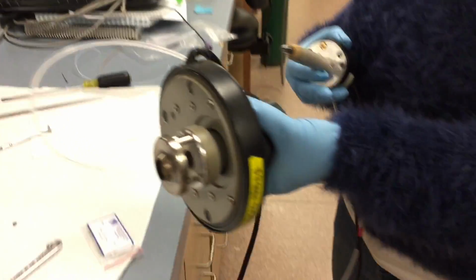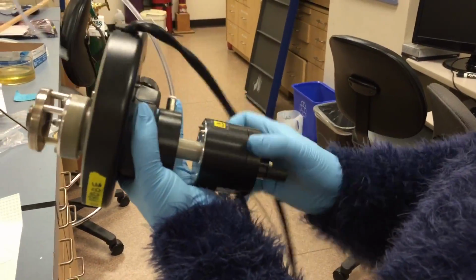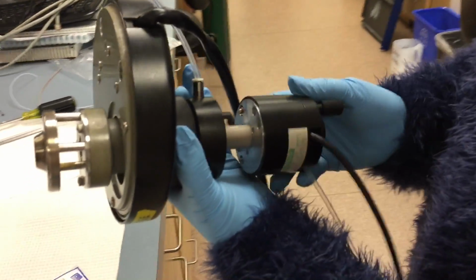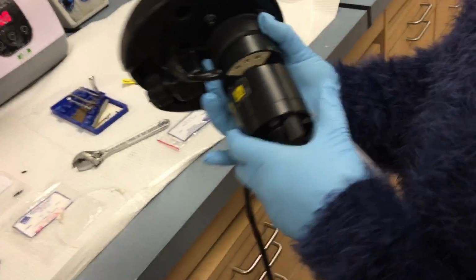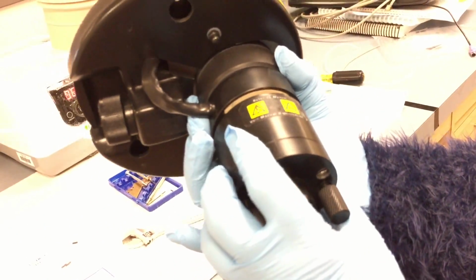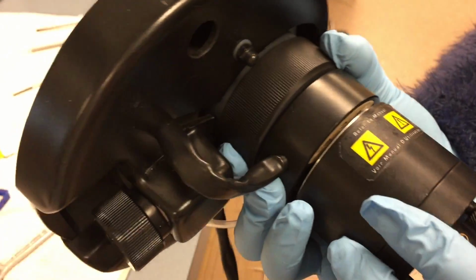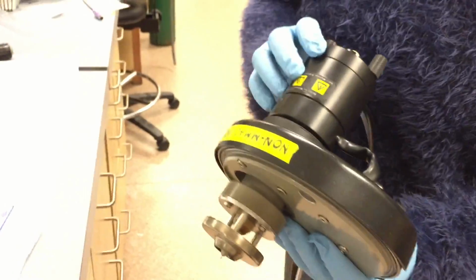So we can put the probe back into the source. And you want to turn it so that these two contact points, I'll turn it for you, make contact with the metal sources there. But you'll know they've made contact because they'll screw in together. So now I'm going to reattach the spectrometer.